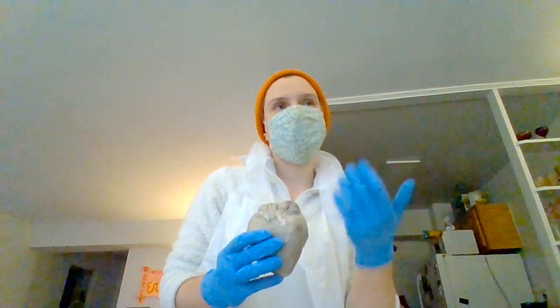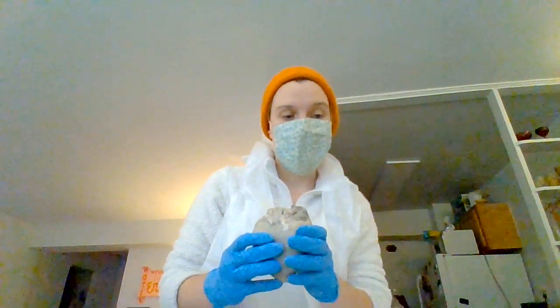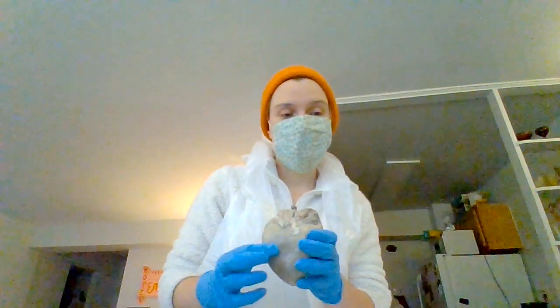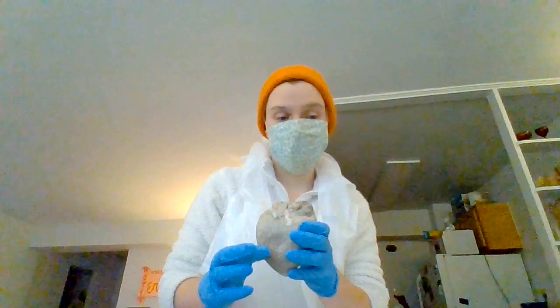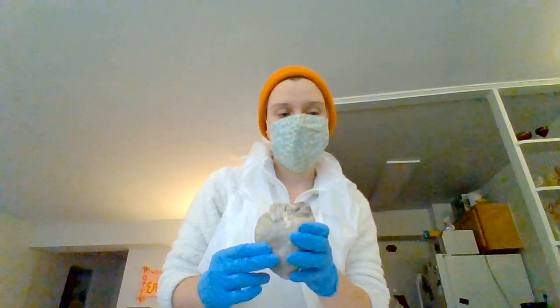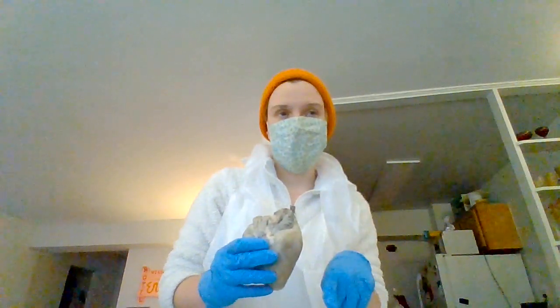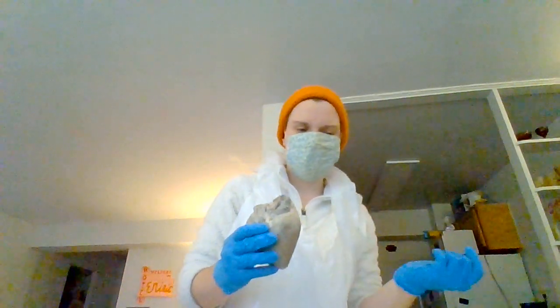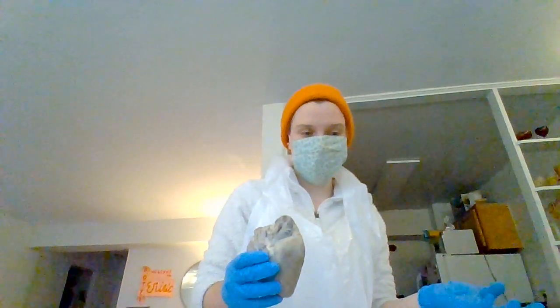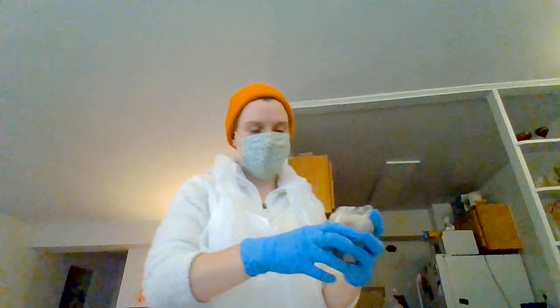because that's what's sending the blood out through the aorta, which is the biggest artery in the body. And then on the right side of the right ventricle, that's where we're going to have the pulmonic valve, because that's where the blood is outgoing with the pulmonary artery, which is also big, but I suppose not as big as the aorta. So that's kind of that.